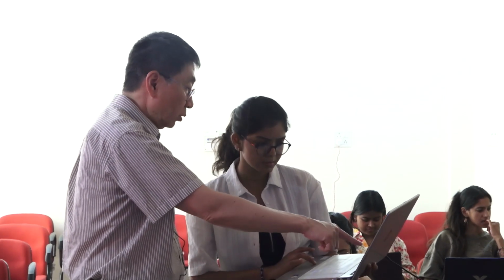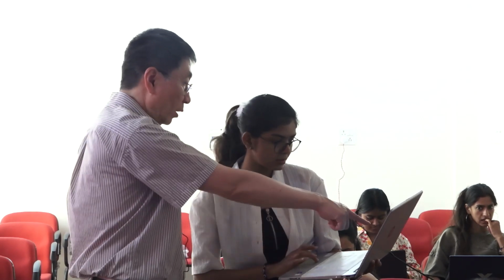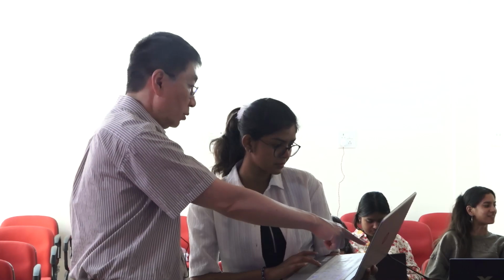Now what do we have to do? Add the terminal residue to the valine. Click on valine, anywhere on the atom. Yeah, so there you go. So now it's an alanine, and now you can do Mutate, Simple Mutate, right here.